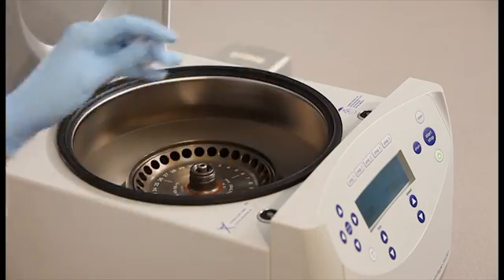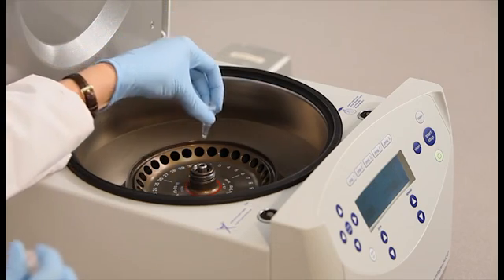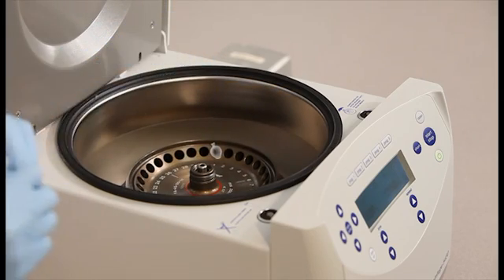Next, place the tubes containing the recovered liquid into the microfuge and spin for 5 minutes at 12,000 G.